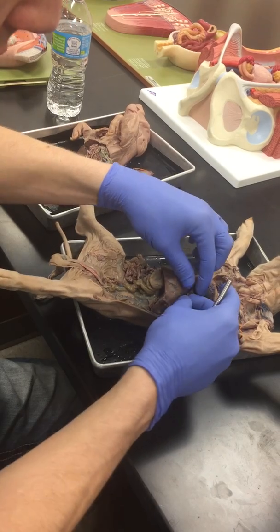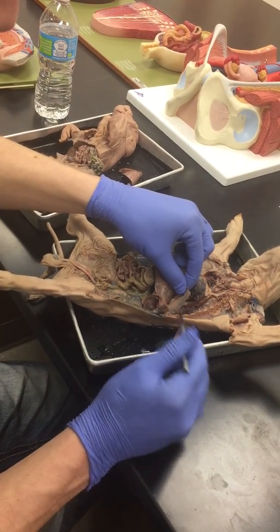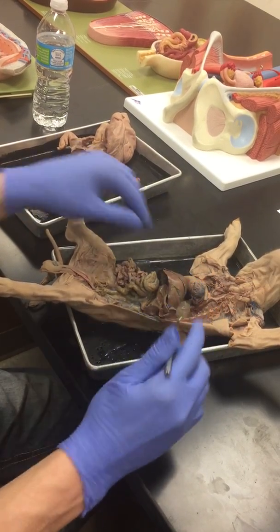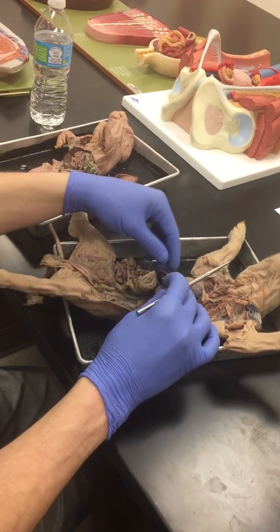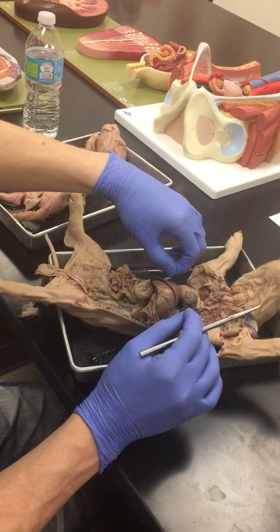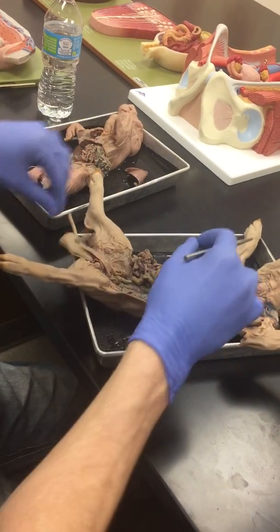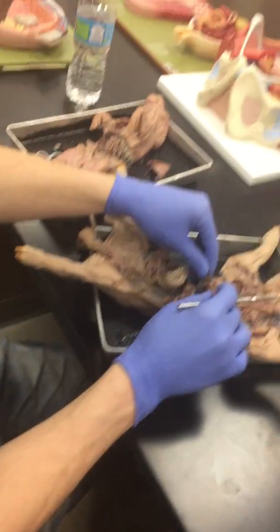This flap of skin that is left was the diaphragm once upon a time. So they can ask for that. Going underneath the diaphragm, we have the liver. They have a huge liver compared to us. And this was your umbilical vein, where you cut the umbilical cord off. So that was connected there. And it runs down into the inferior vena cava, like it's supposed to.